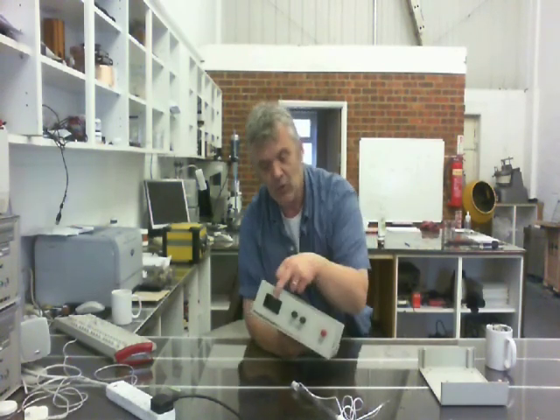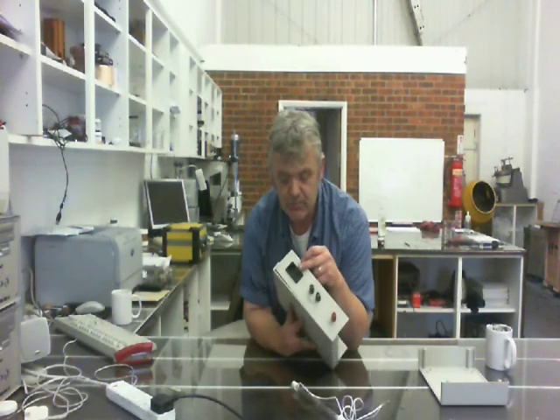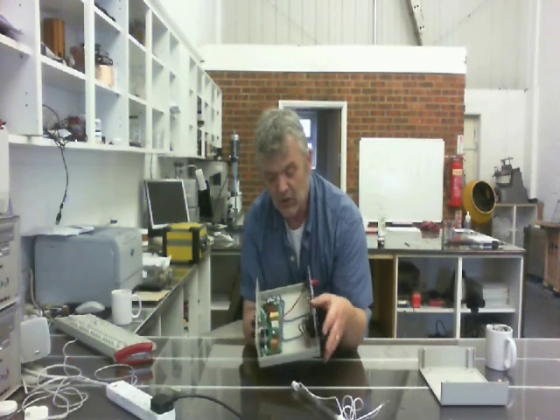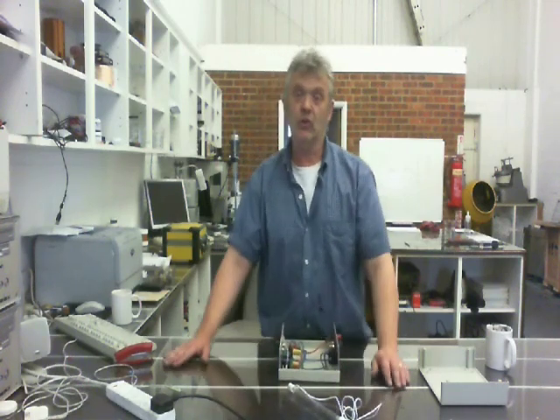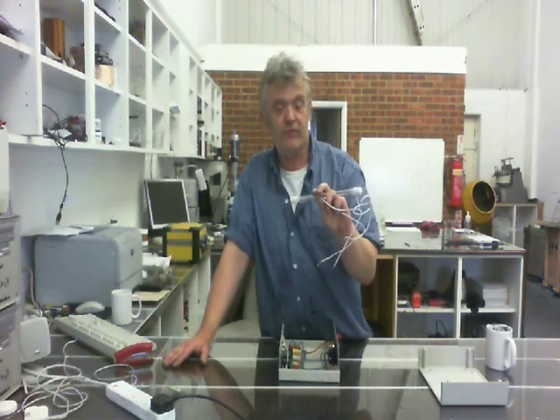This thing I bought just from Maplin's or Radio Shack actually. It's obviously a mains plug, but it's fused, so there's a fuse in there I can flip out, and I can flip that off and on and put my kettle lead in there. So that's actually the whole unit finished now. Then all I have to do is put on the lid, screw it together. Once I've done that, I need to make a housing unit for the lamp.